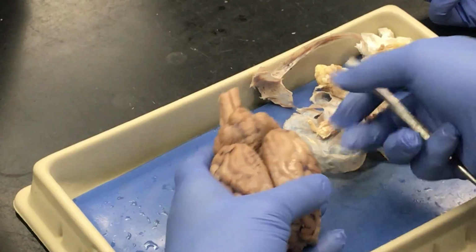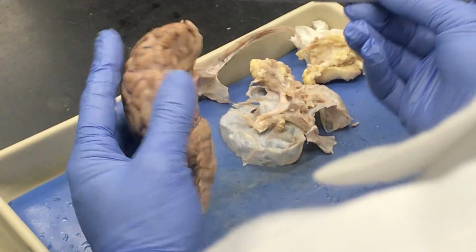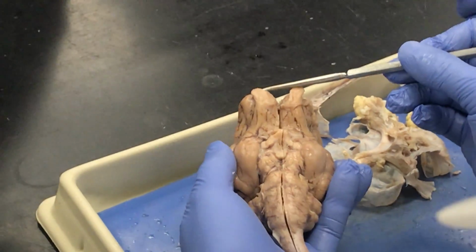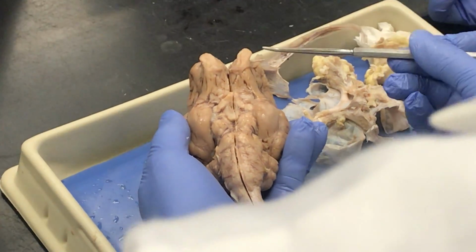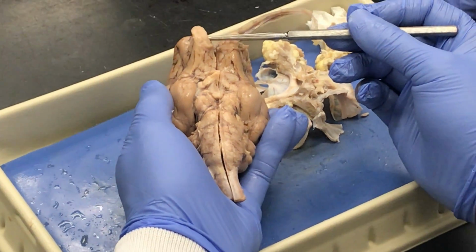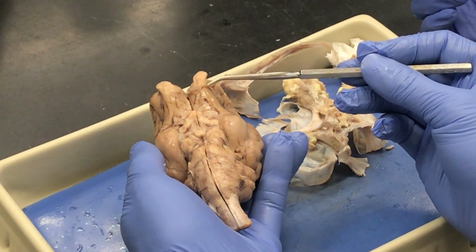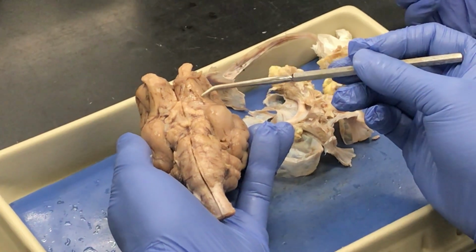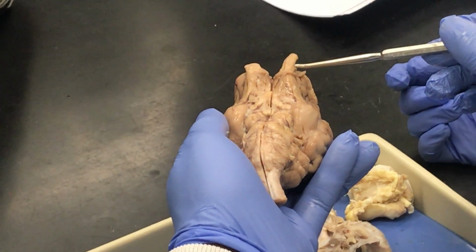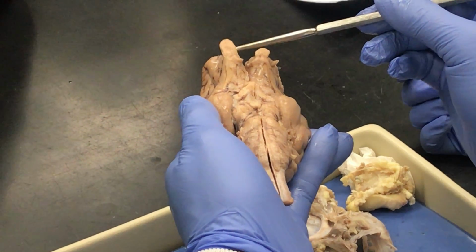And the olfactory bulbs. Olfactory bulbs. So on the inferior side, you notice right here at the anterior part of the brain, here's a good specimen of olfactory bulbs, nice and large for this animal. And the olfactory tract. And from the olfactory bulb, you just follow it, and it leads back to the olfactory tract. All right, so the bulb here is kind of flapping out, and then I can just follow it back to the tract on either side.